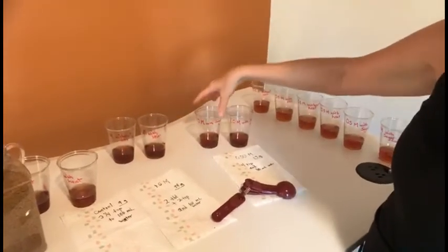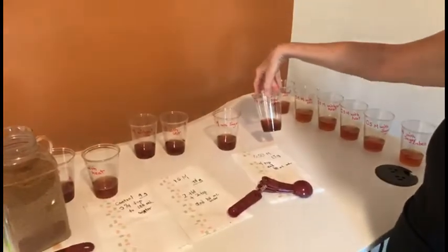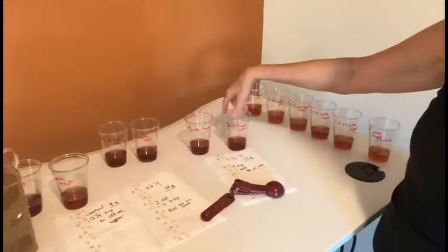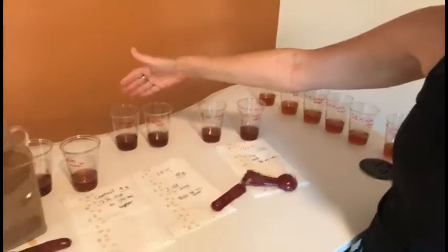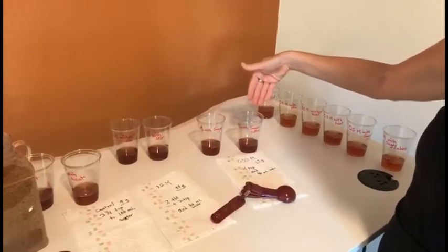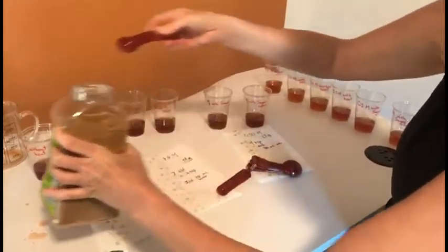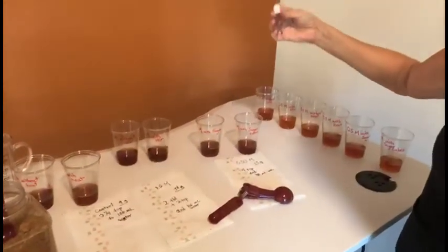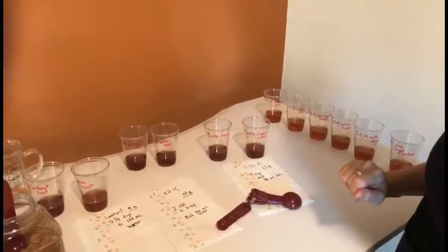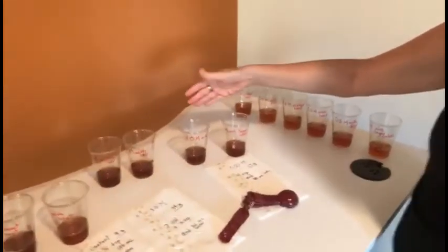All right, next is the 1.0 molar with sugar and the 1.0 molar with sugar cubes. So this would be particle size. Okay, this one was agitation, and this one would be particle size. All right, so here we go again. Teaspoon of sugar, and then a sugar cube. 1 cube is approximately a teaspoon. Okay, but I am not supposed to stir this. That's the thing, you can't do 2 different solubility tests.